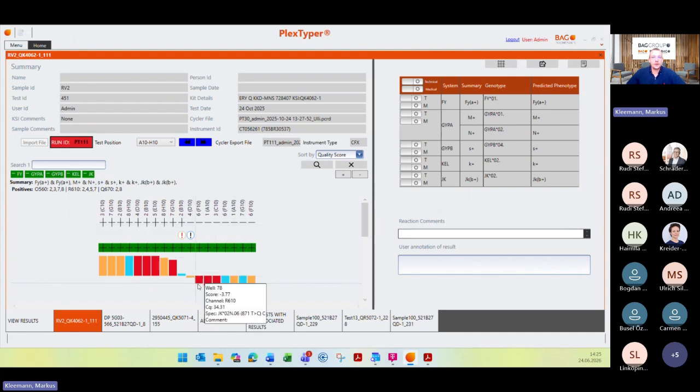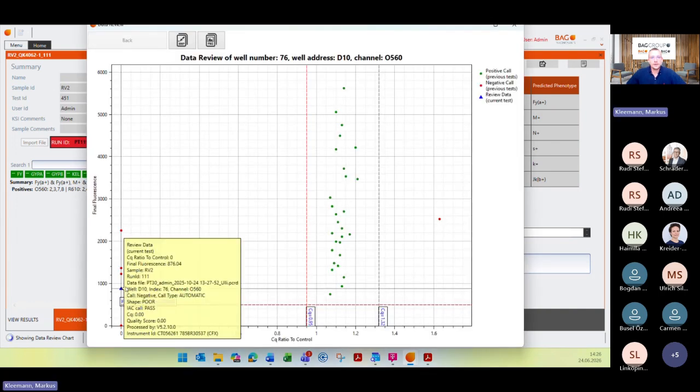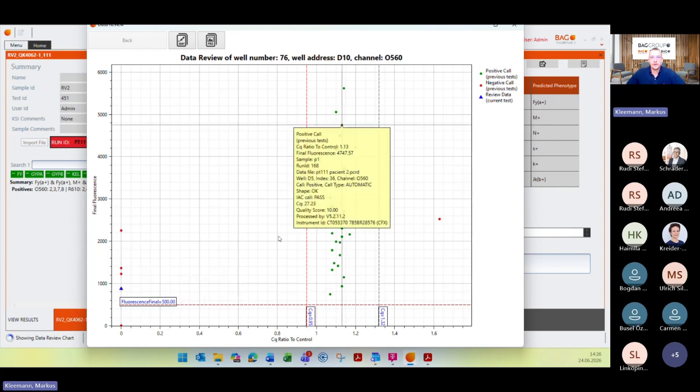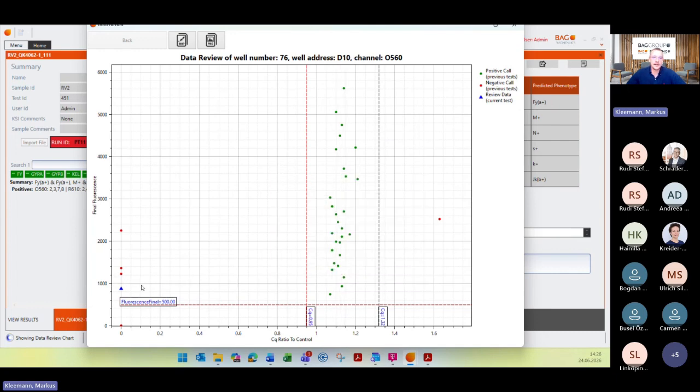But now we go more into detail of these tools here. You can see this blue mark or flag, and also this red one. The blue one means this is the basic warning, and that means no CQ could be calculated. So you can see that your reaction is located here. When you check it, you can see, okay, this reaction is far away from the area where we look at positive reactions. So this is like a good sign.